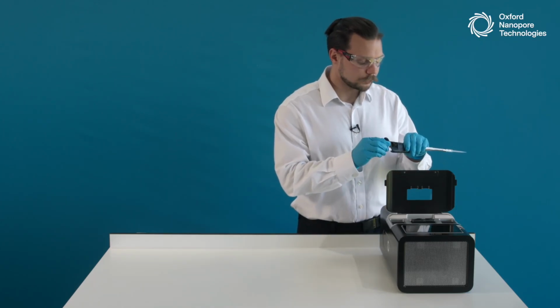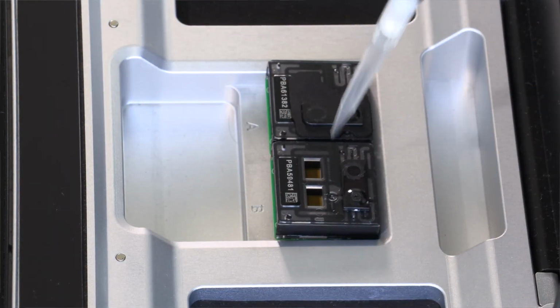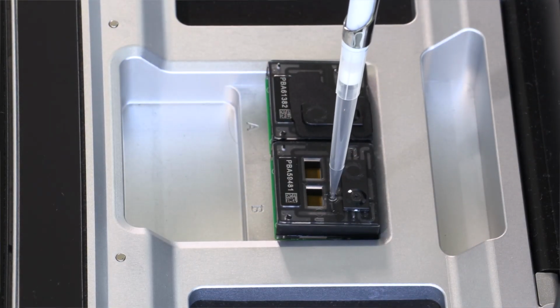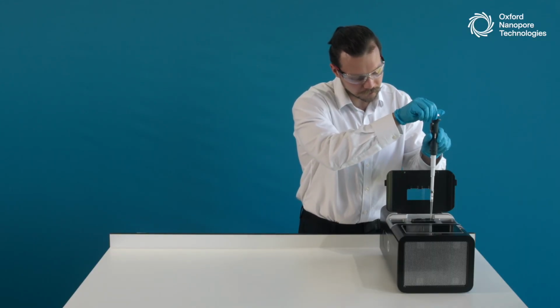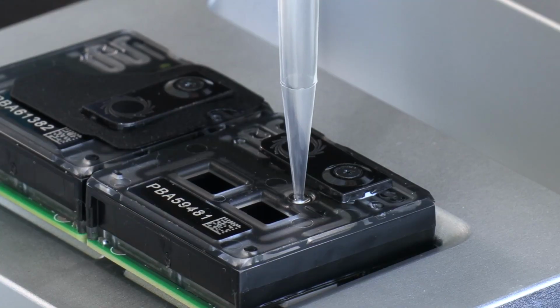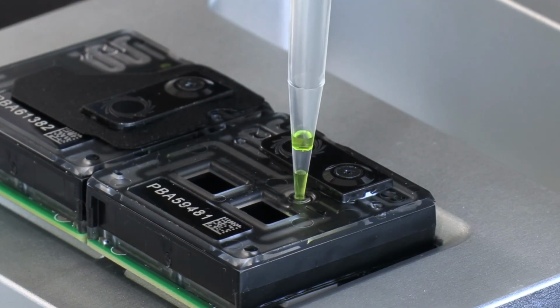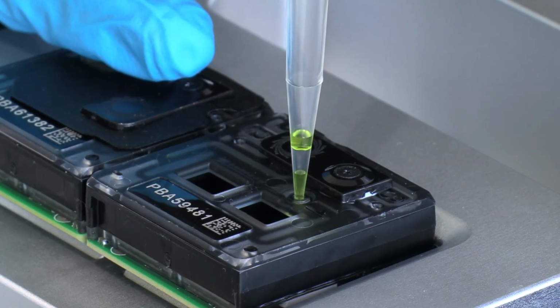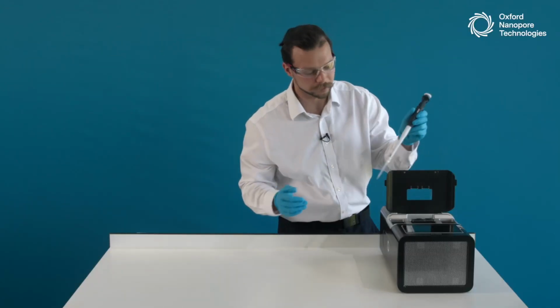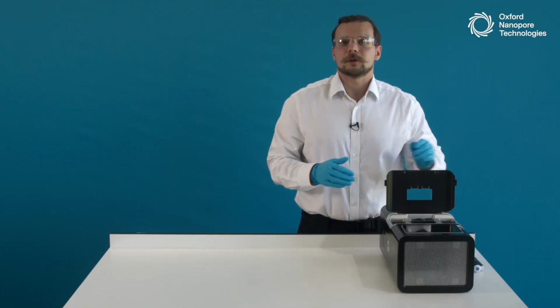As a first step, I will set up my P1000 pipette to 200 microliters. I will insert it into the flow cell, make sure it's nice and snug there, it makes a seal, and I will very carefully rotate the pipette dial anti-clockwise to aspirate in a controlled manner a small amount of liquid out of the flow cell until I can see that there is no more air in the priming port. Now I see that a small amount of storage buffer, the green colored liquid, came into the pipette tip, so I know that there is no more air, and now I have access to the liquid. I will expel that onto a clean tissue and dispose of it, and the flow cell is ready for priming.